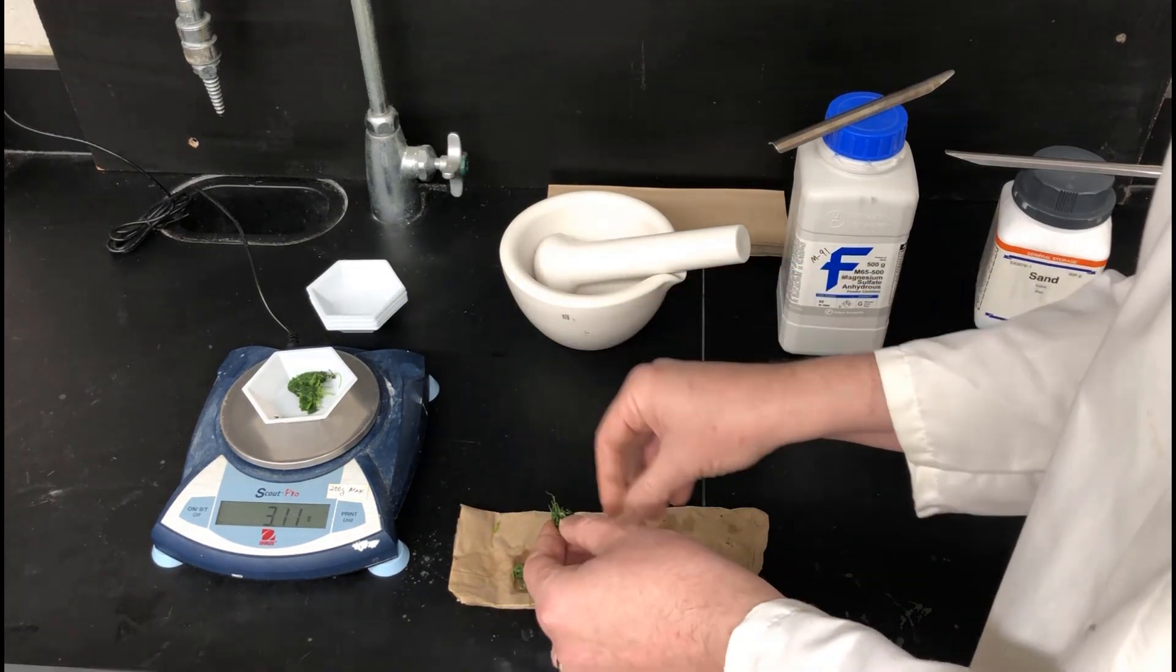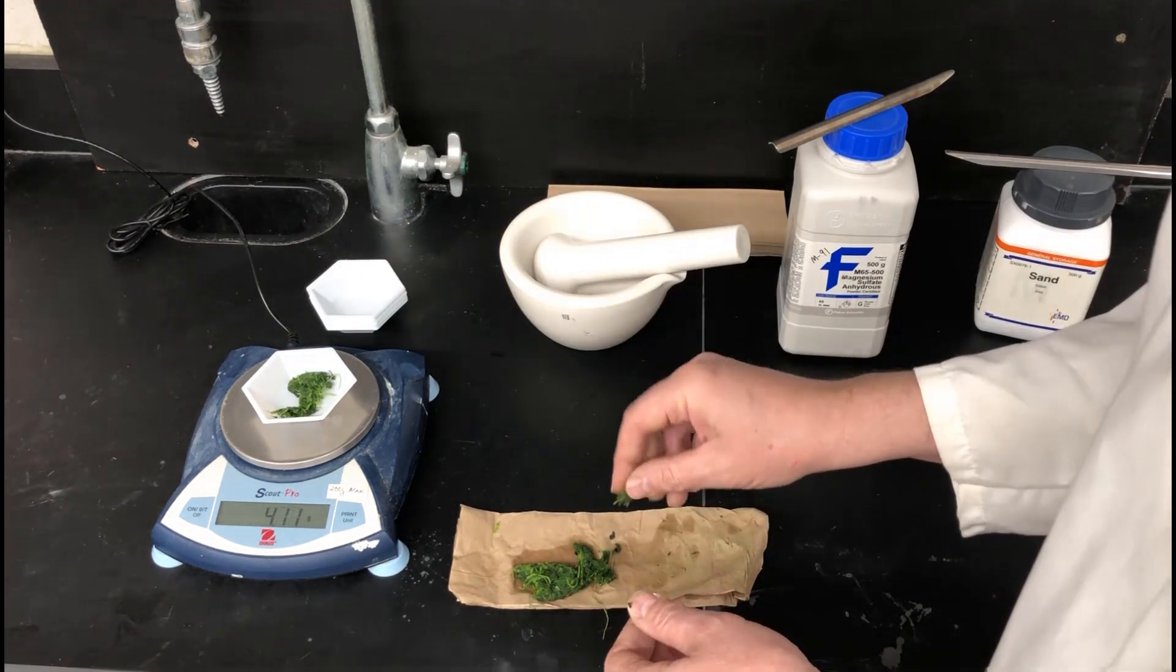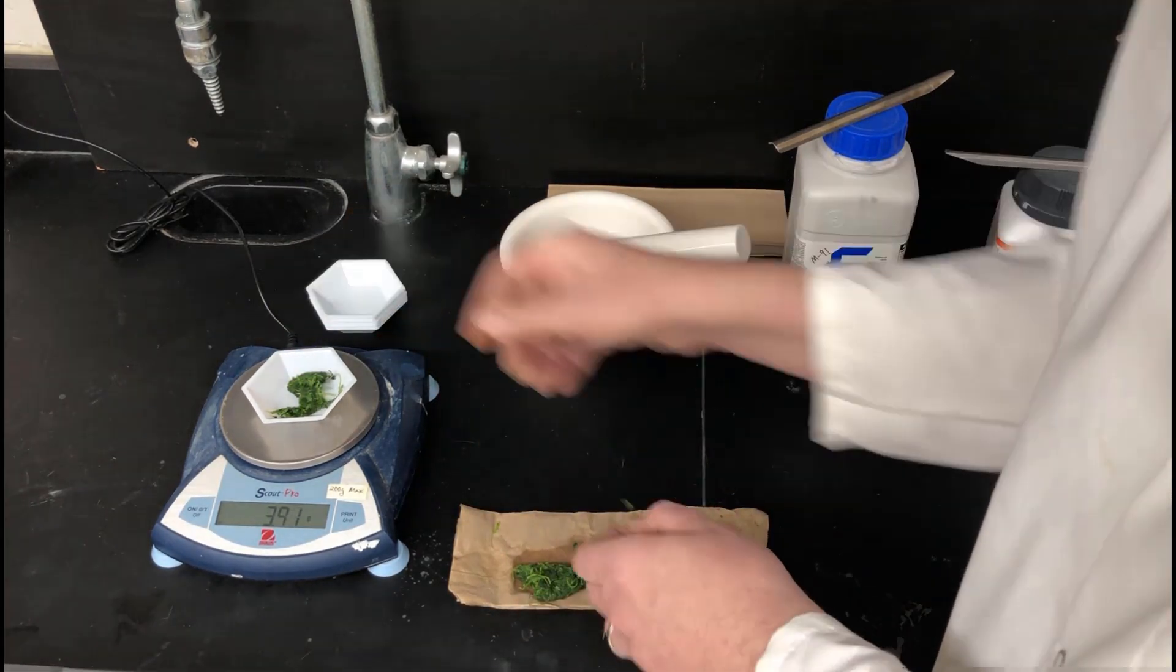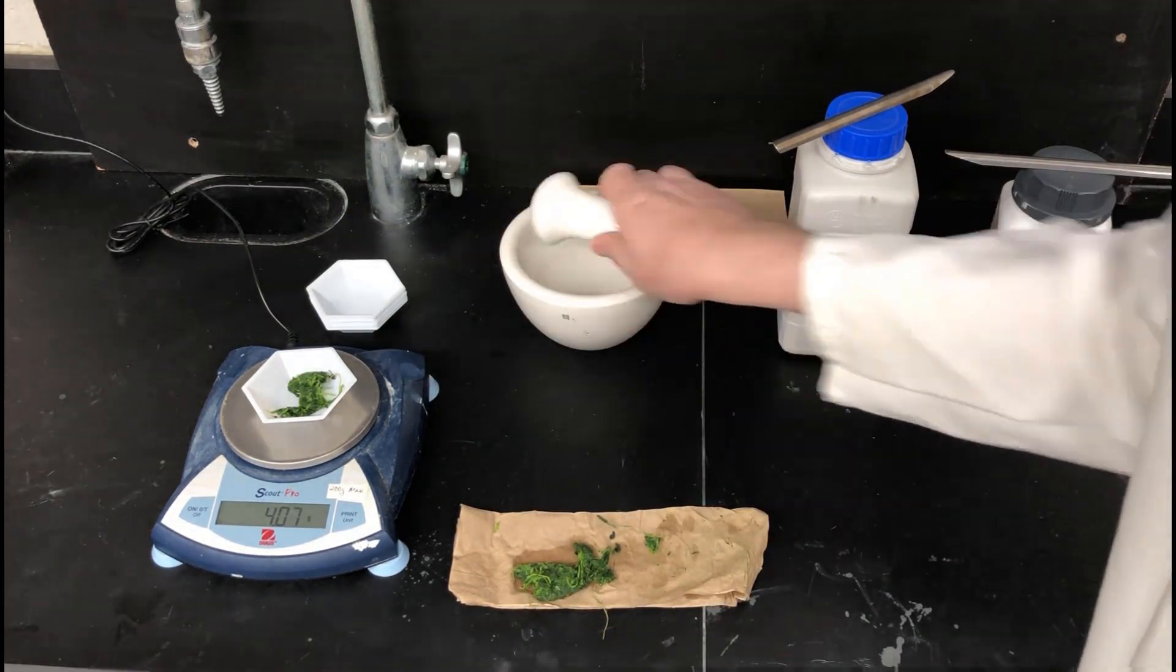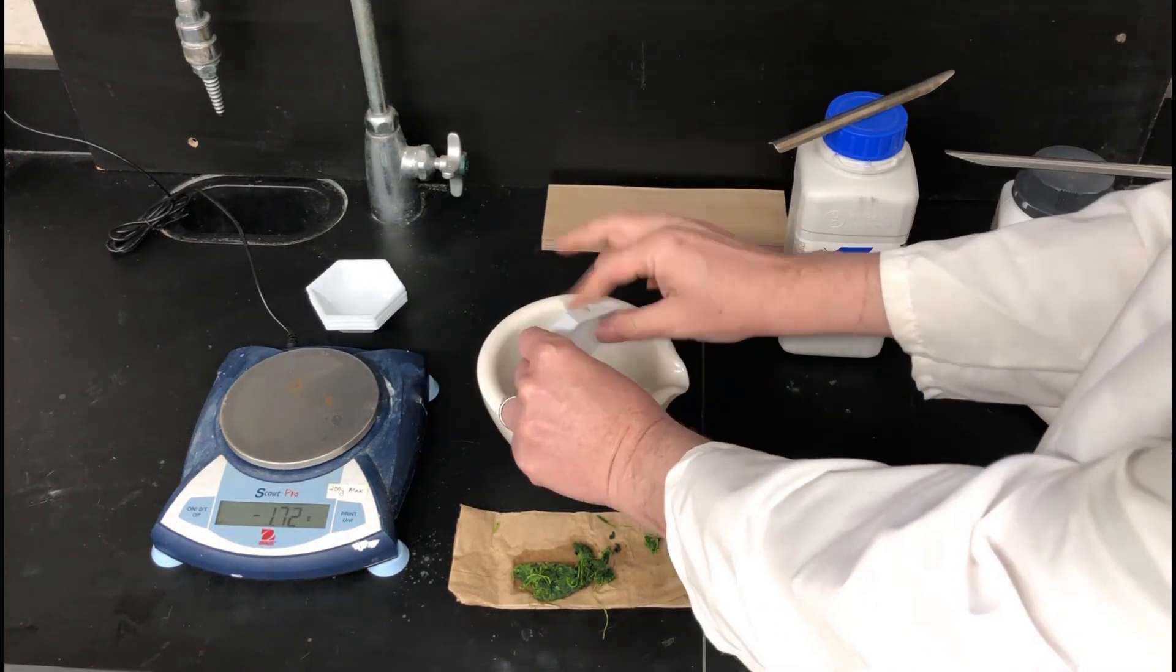Just try to get something fairly close and then record whatever it is you do weigh out. So in this case it's just a little over four grams is what I'm going to end up with. And then we'll take that and put that in a big mortar and pestle. We're going to grind it up here in a little bit.